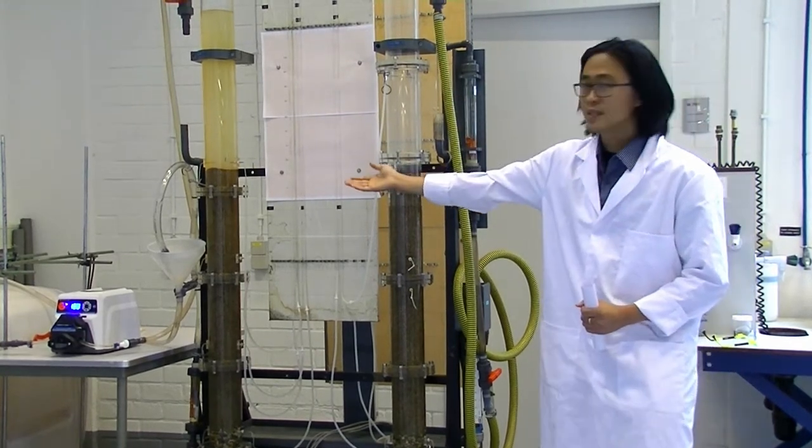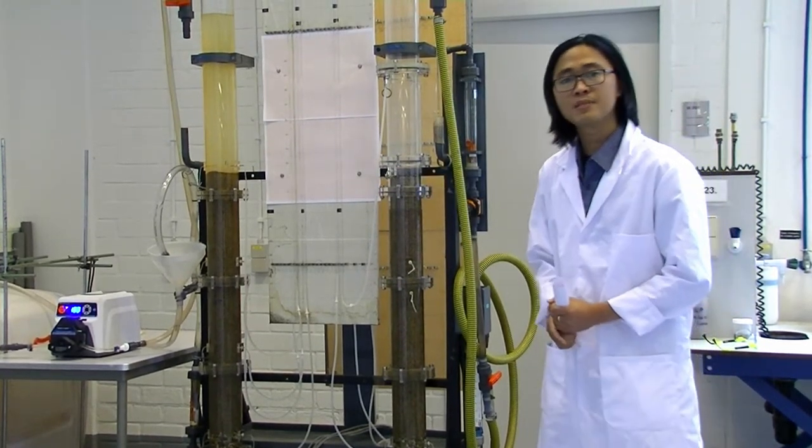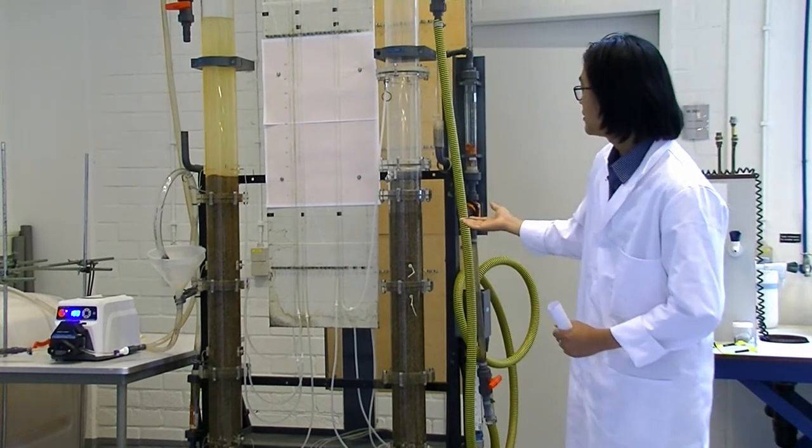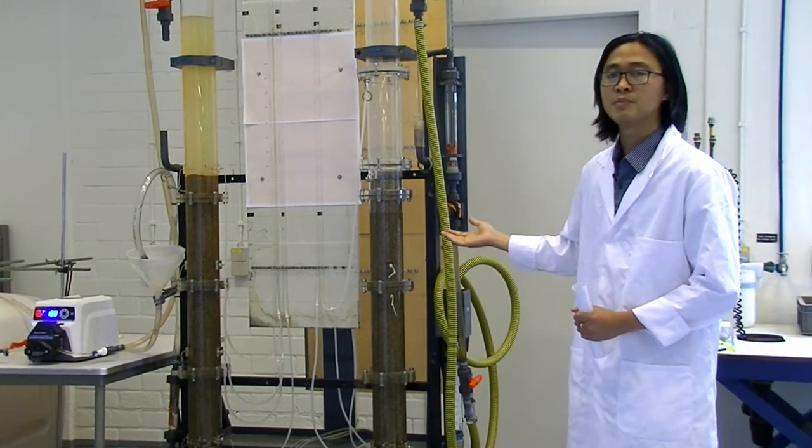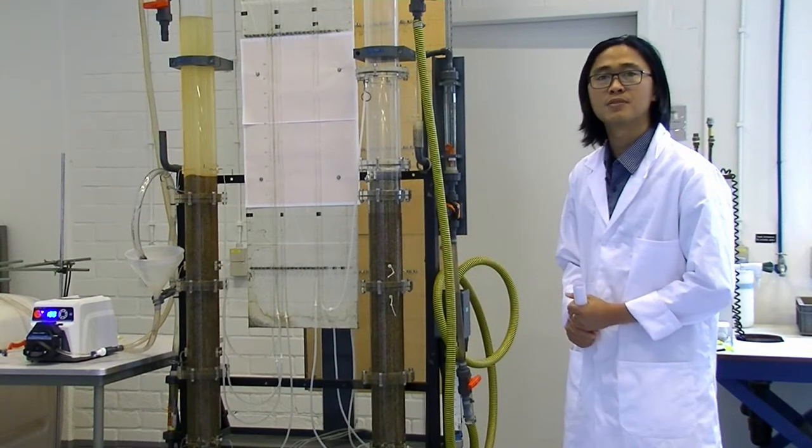The first column here we will use for our filtration experiment, part one. And this column we will use for our backwashing experiment in the second part of our experiment today.